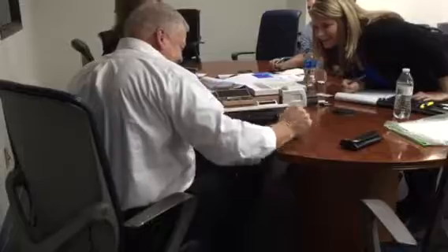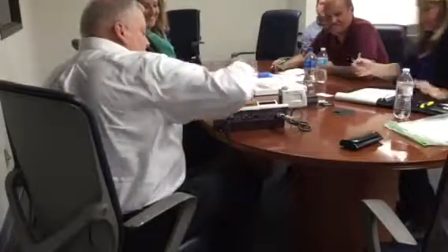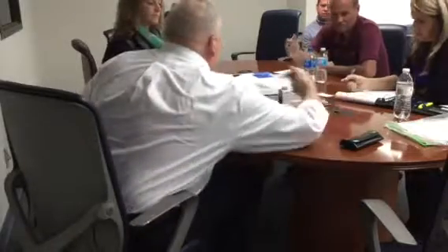Auto return, you probably want to keep it on. So auto return, turn on. Okay? So it's going to drag back across. Before it came this way, it always pulls. So when I hit start, it's going to pull.